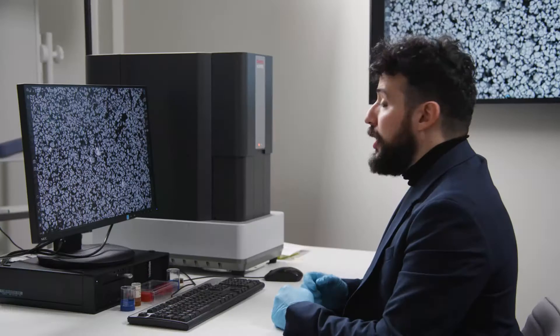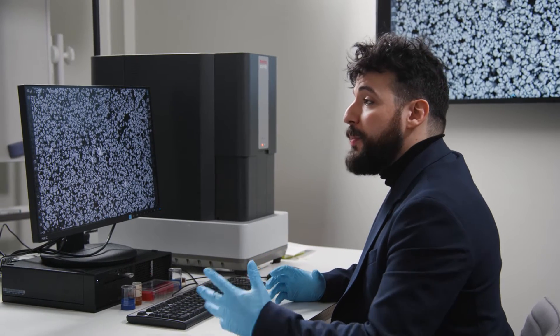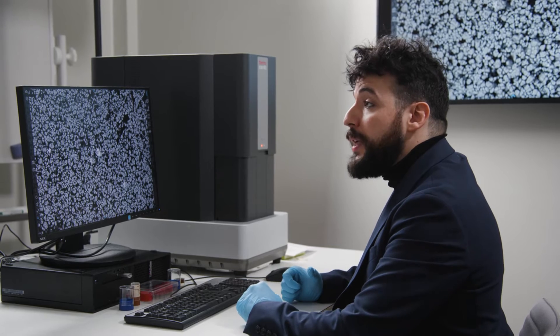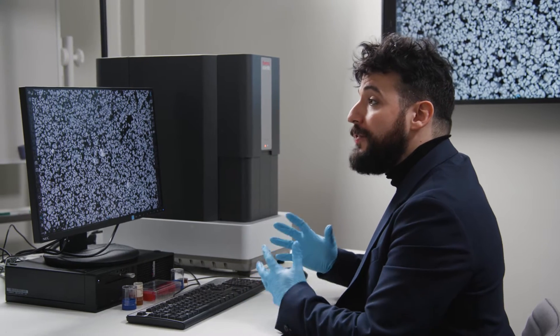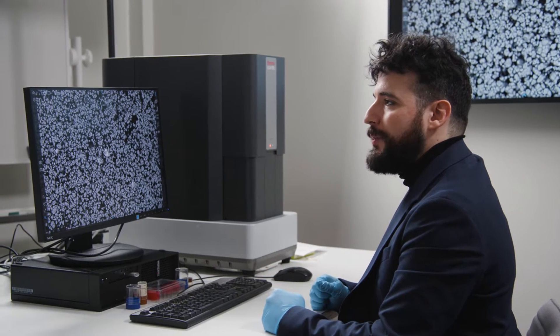Welcome to Thermo Fisher Scientific. I am Luigi and today we are sitting in Eindhoven in the headquarter of the Phenom development. Today we're going to have a look at how energy dispersive spectroscopy works on a Phenom desktop electron microscope.